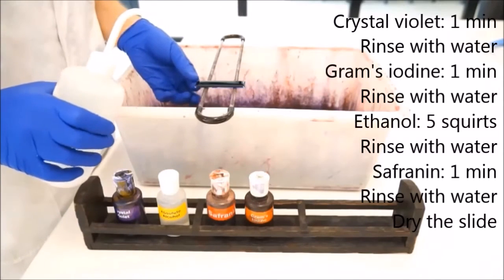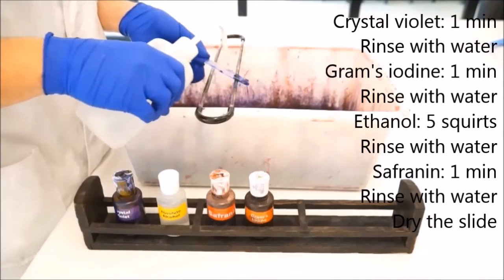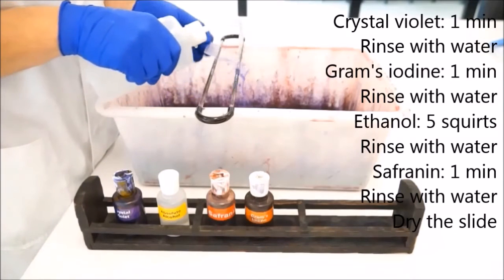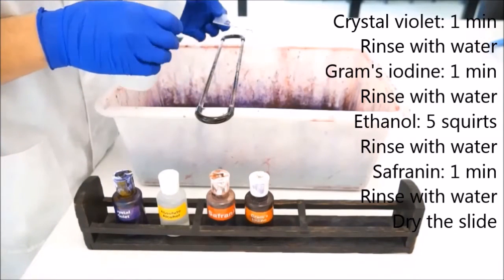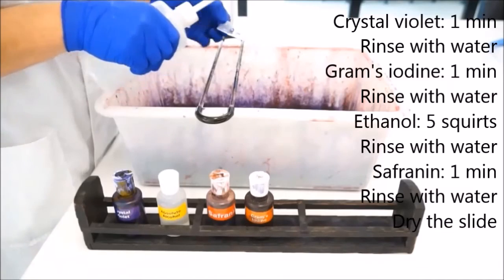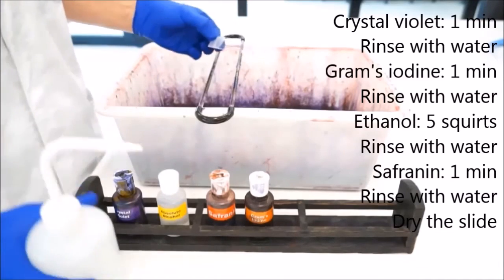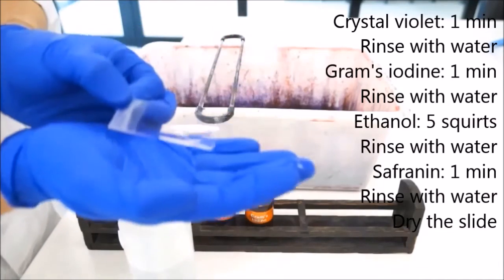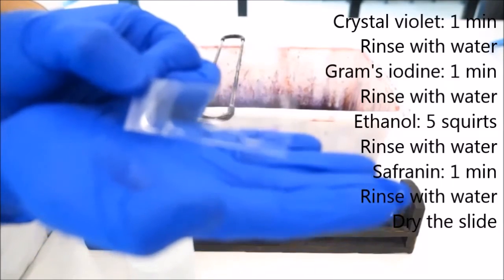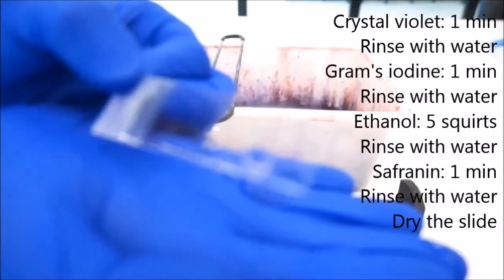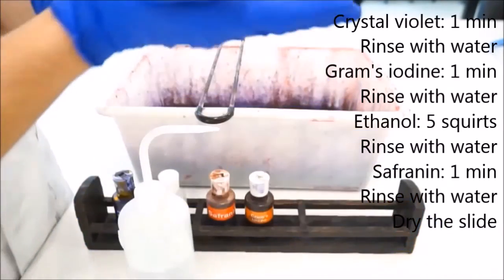Let's just pretend that's been on there for a minute. Get some water and tip that at an angle and make sure you rinse that nice and thoroughly. You should be able to see that your white bacteria have stained purple. There are purple stains on there.